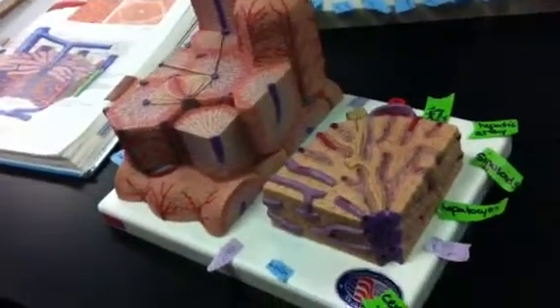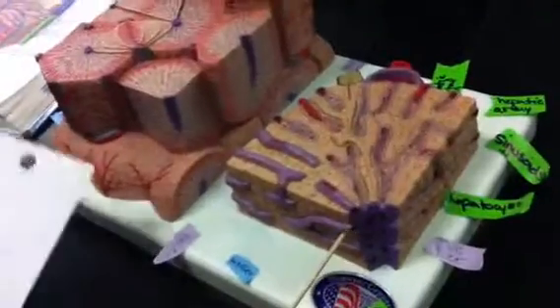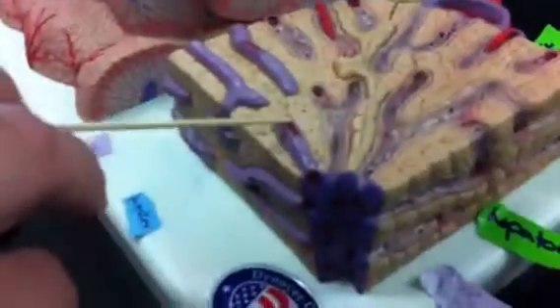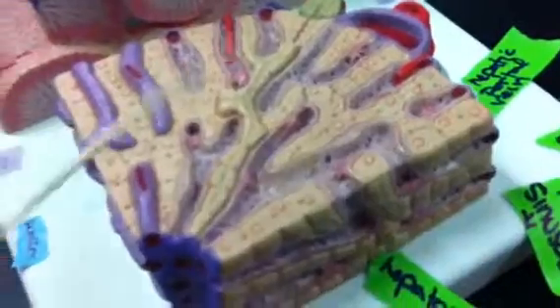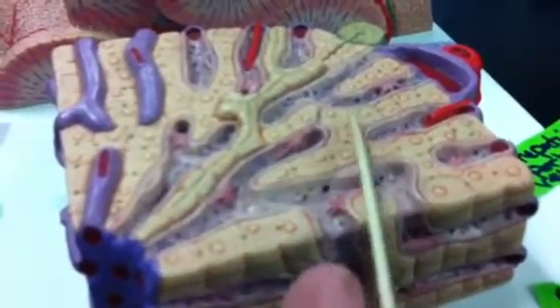Microscopic anatomy of the liver. This is the central vein right here. Right here are the hepatic macrophages and the sinusoidal walls. These are the sinusoids — the pink that look like stars, or Kupffer cells. This is the bile duct and this is the bile canaliculi. The transparent green all around are the bile canaliculi. These are the hepatocyte plates and the hepatocytes inside of them, which are the cells.